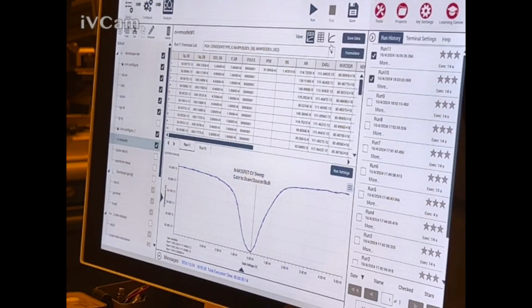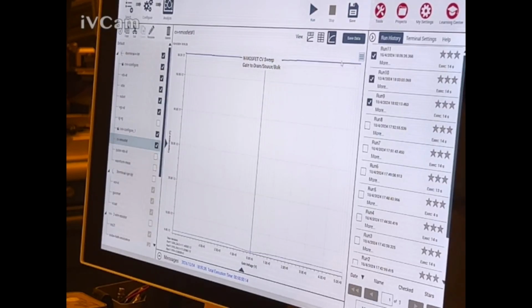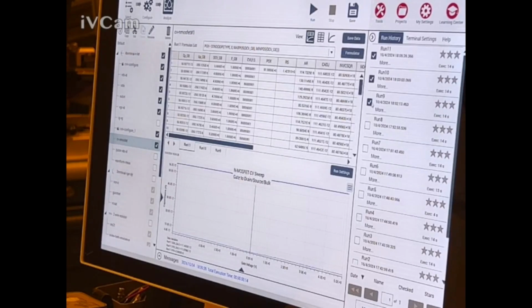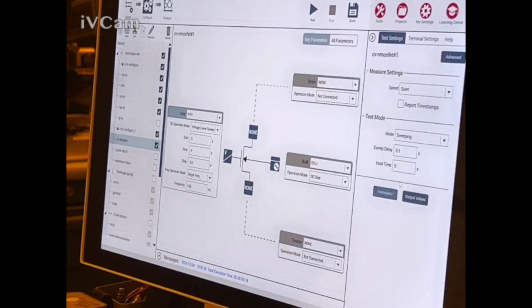There it is. That's a bug. But wait, they're the same though. Oh, because they were the same. One of them was different. Let's take that one and that one. What the heck is going on here? I don't know which test was which anymore. I think this was the same with the compensation. Then we had one with the compensation off, which should be this one. Let's just try running it again. Let's turn off the compensation.